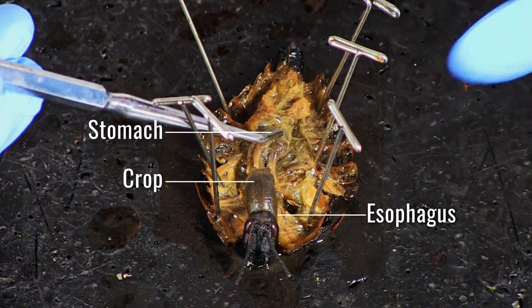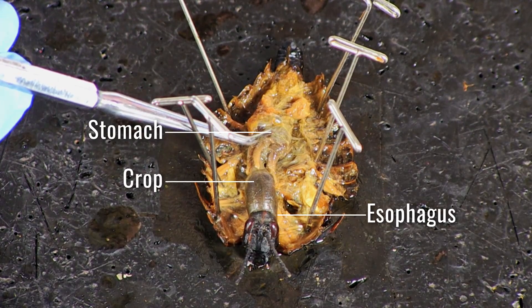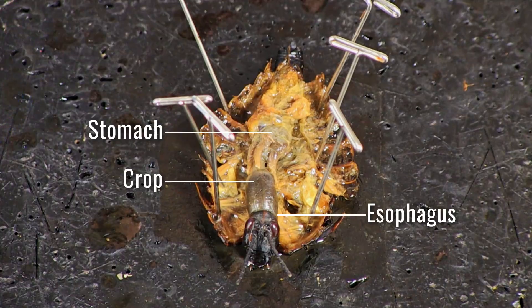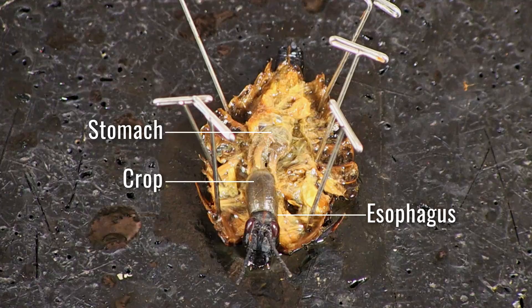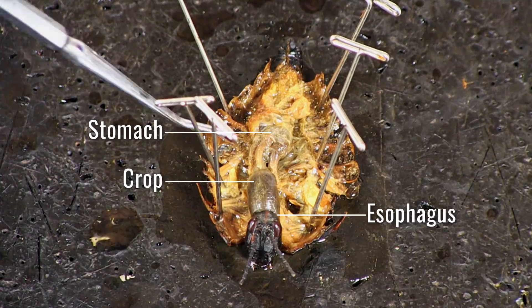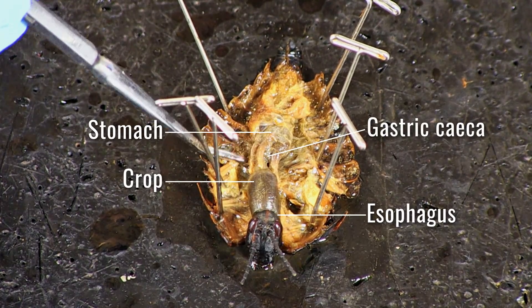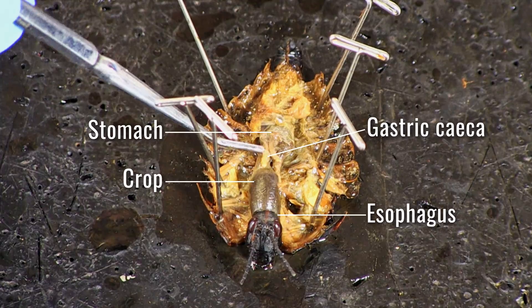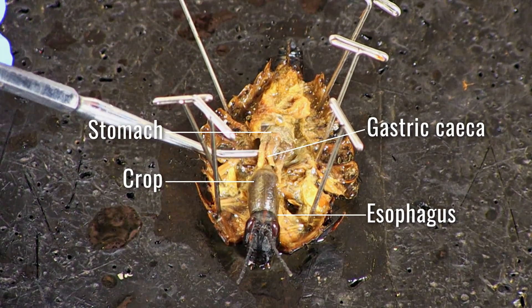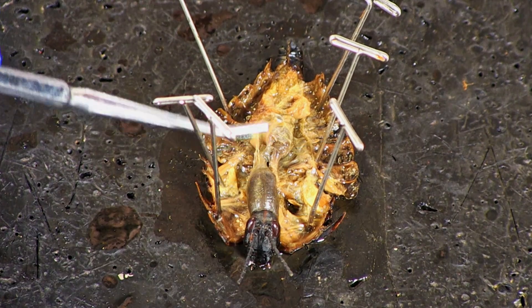This is where digestion takes place. Small molecules are absorbed into the bloodstream after passing through the walls of the stomach. Take a picture and label the stomach. Connected to the digestive tract between the crop and the stomach are pouch-like structures called gastric ceca that excrete digestive enzymes, breaking down food and helping with its absorption. There should be several pairs of these finger-like extensions.